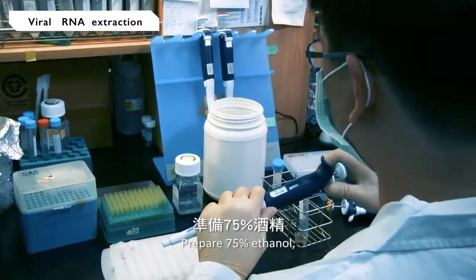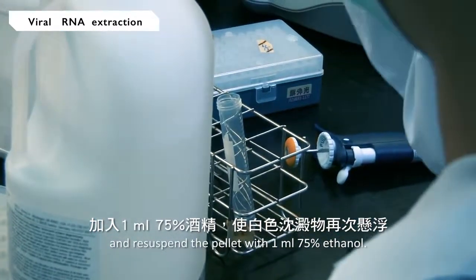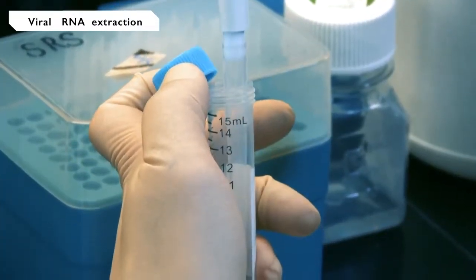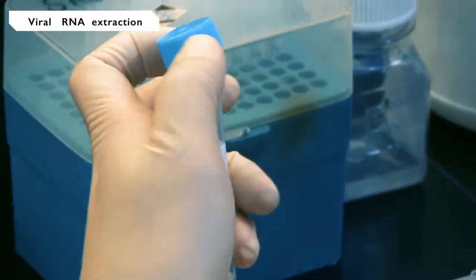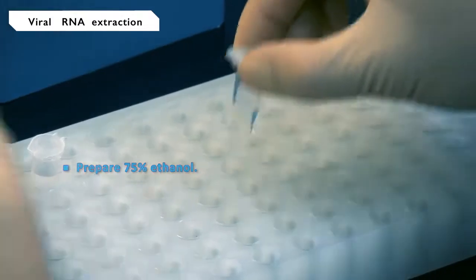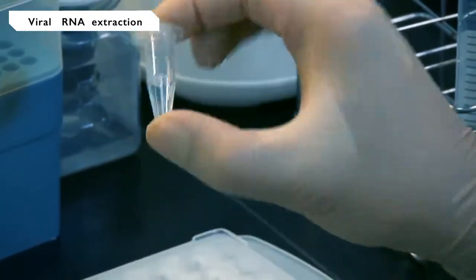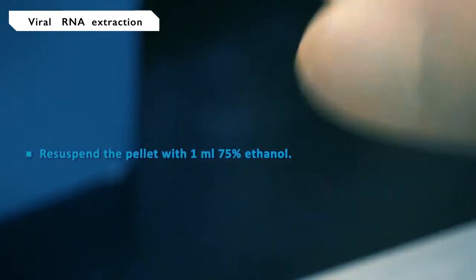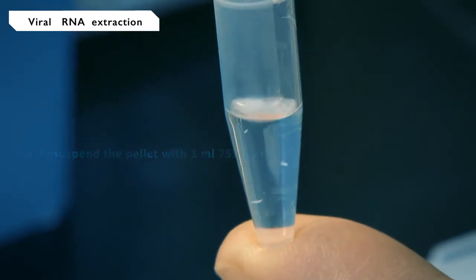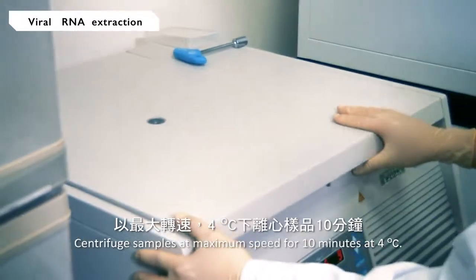Prepare 75% ethanol and resuspend the pellet with 1 milliliter of 75% ethanol. Centrifuge samples at maximum speed for 10 minutes at 4 degrees Celsius.